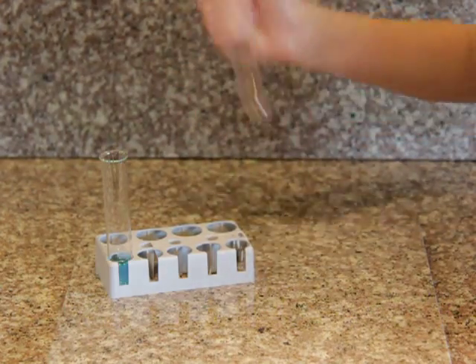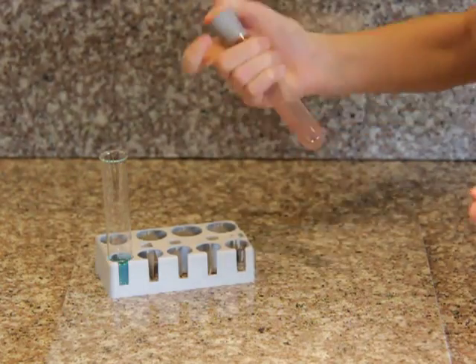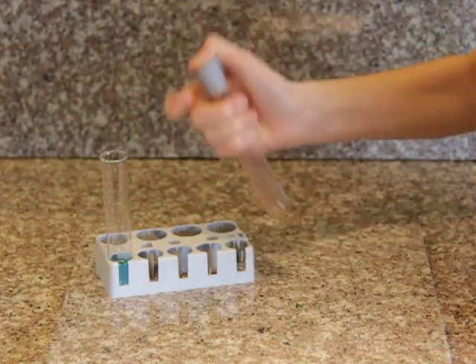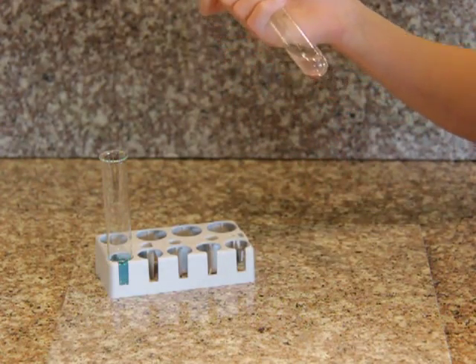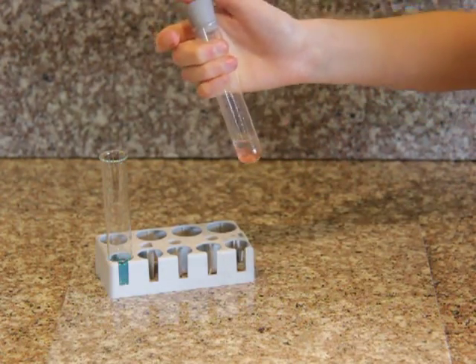It's getting warm. And now the liquid is now clear.